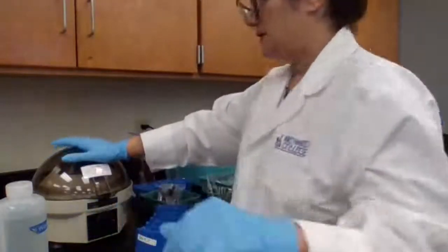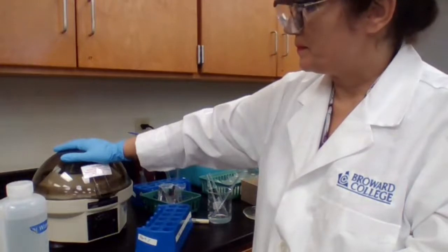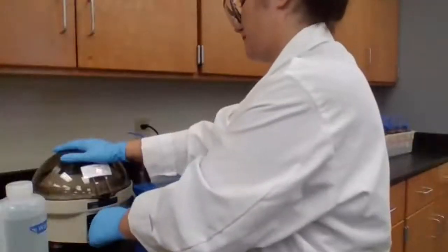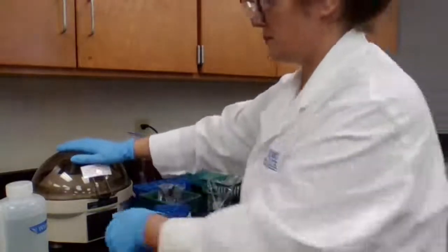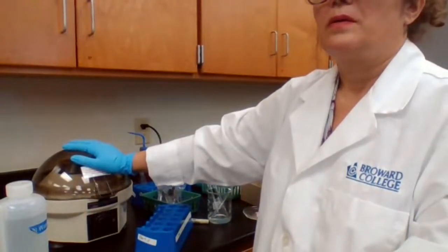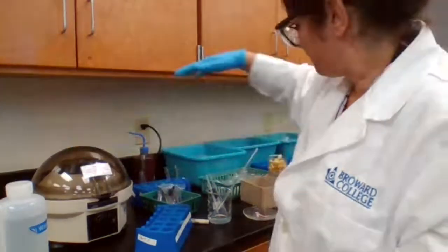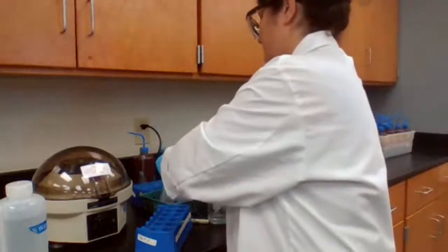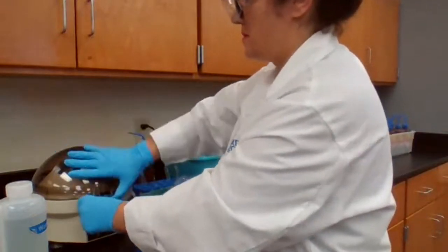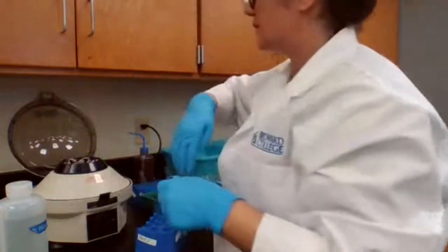That is just to wash the precipitate. Okay, wait until it stops.